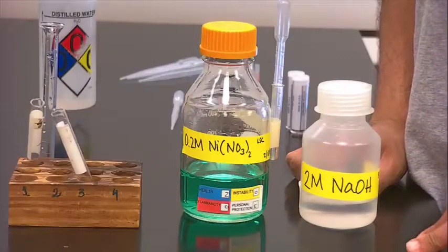That completes ammonium nitrate. You'll do the same thing with barium nitrate, reacting with sodium bromide, sodium sulfate, sodium hydroxide, and sodium carbonate. Like that, you'll complete this table, looking for precipitate, color, bubbles, heat, or cold.